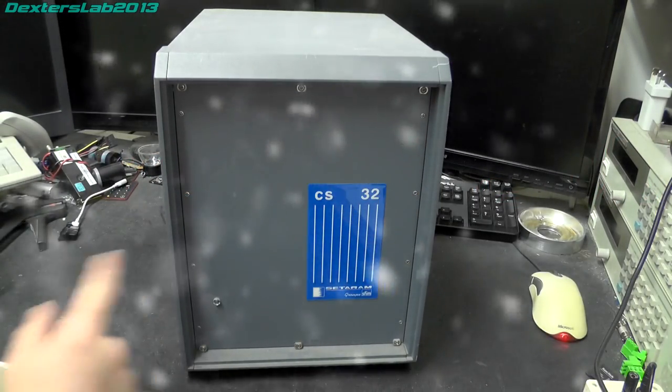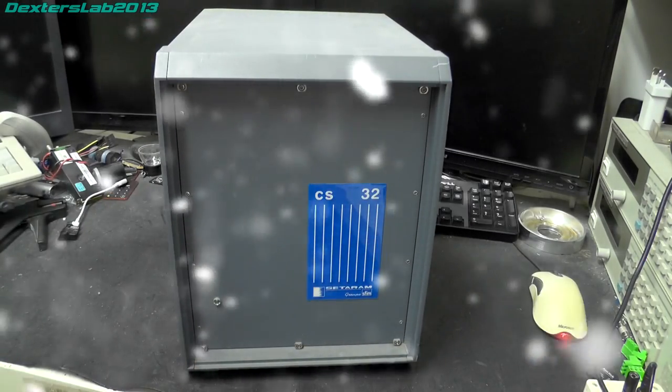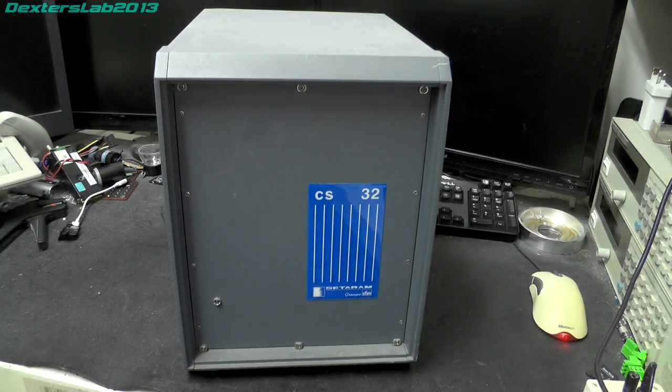Today we're going to have a quick look at this weird little blue-grey box here. Now, bizarrely, this was actually listed on eBay as a Setaram Group SFIM unit, which is a completely ridiculous description to put on an eBay auction. I think this might be called a Setaram CS32. And yes, if you start Googling around for that, you'll start to find a bit of information on this.